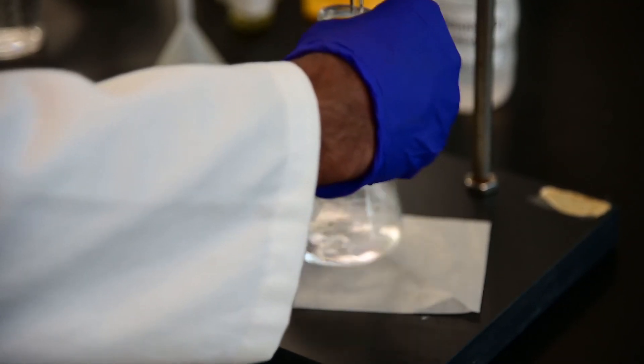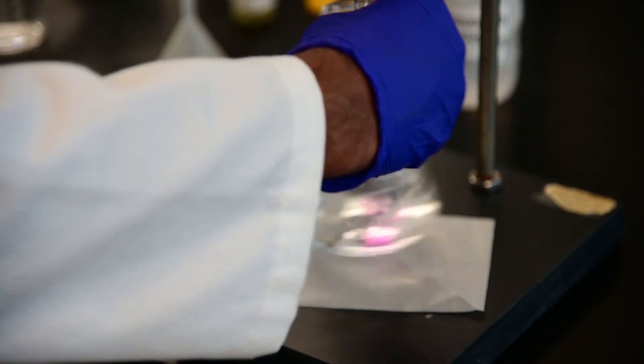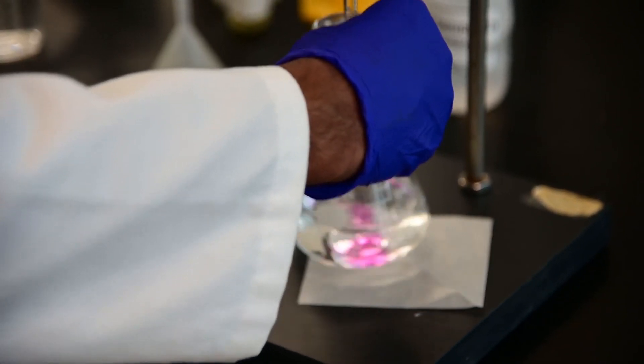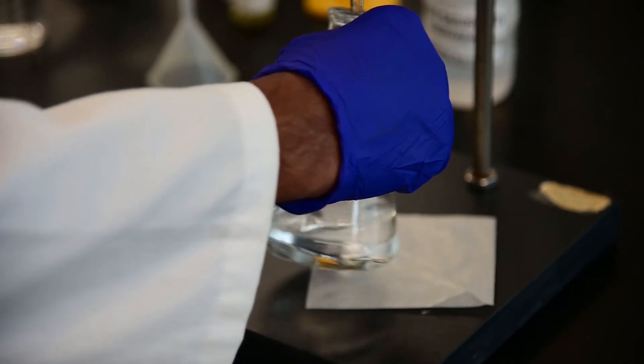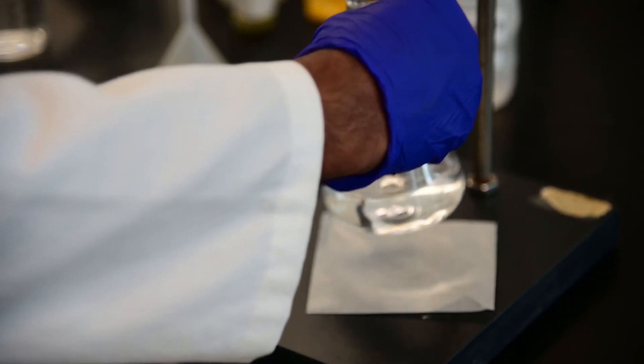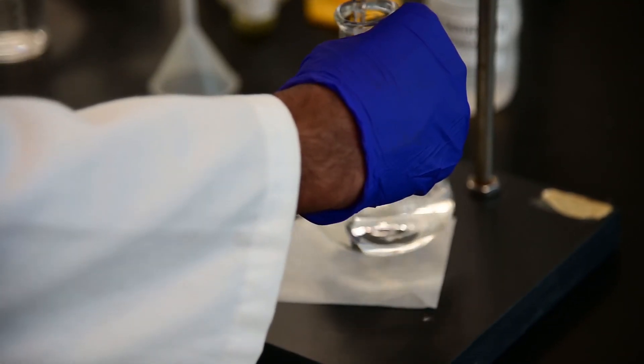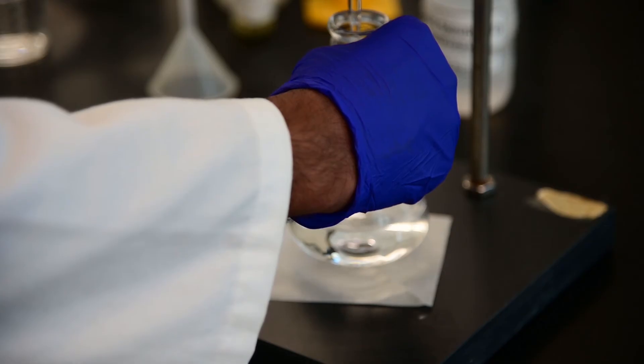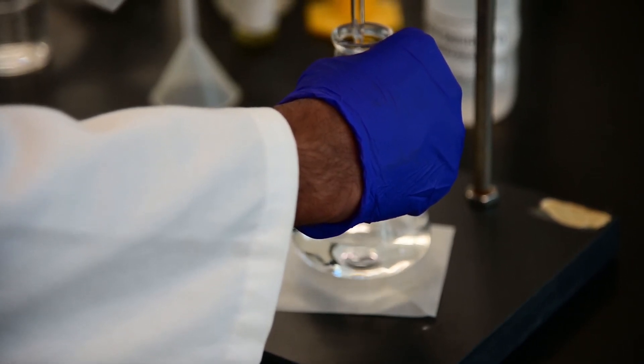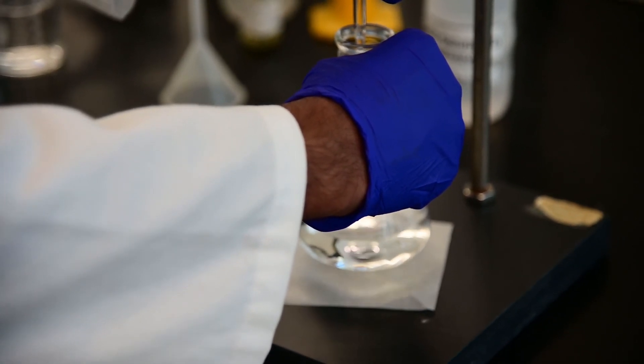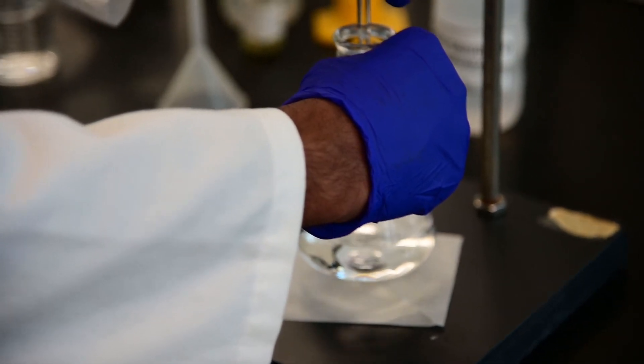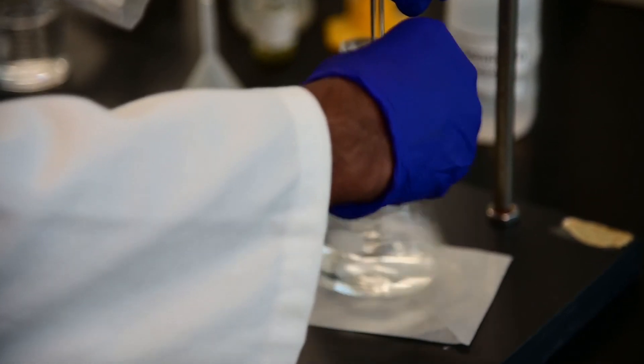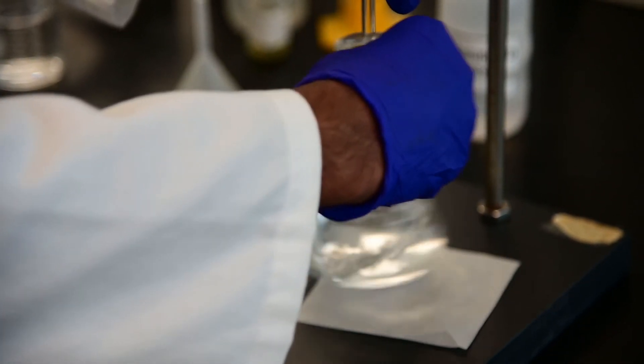And very important is to not to get frustrated. Now I can see that the color, though I'm shaking it, it's persisting for longer. So that means we are close to the endpoint. At this point, I will stop and change and make the drop additions slower because we don't want to add too much. This is where you have to become really careful. And try to add one drop at a time. You want the color to change from colorless to faint pink in one drop.